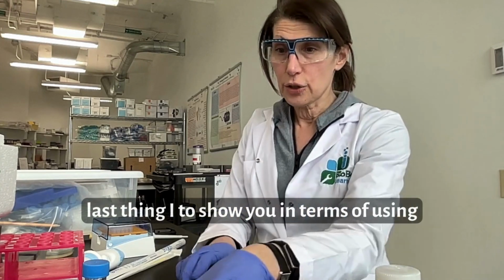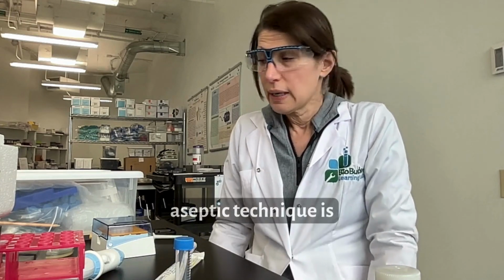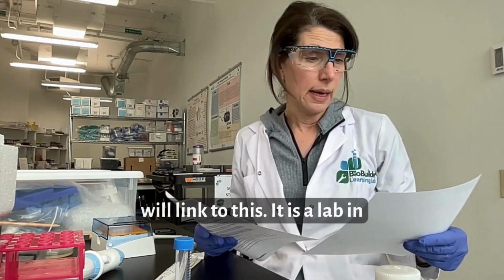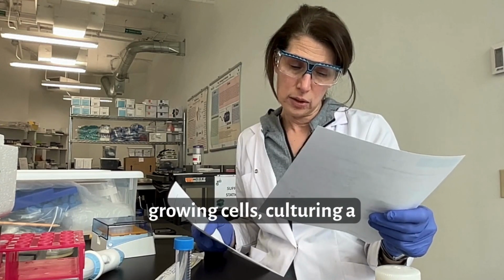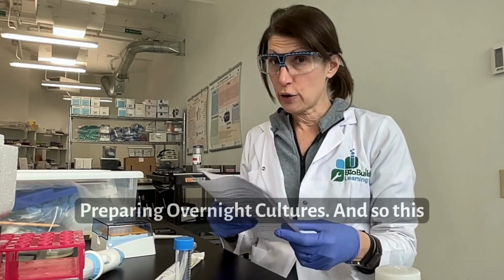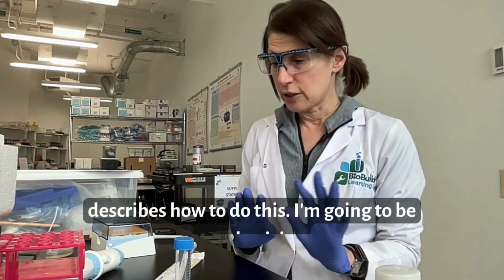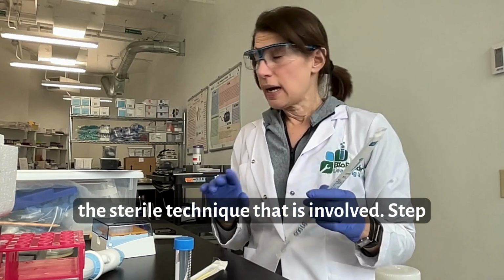The last thing I want to show you in terms of using materials for aseptic technique is part of a lab that we run, and I will link to this. It is a lab in growing cells, culturing a colony from BioTechBuilder lab skills. It's called preparing overnight cultures. And so this protocol explicitly describes how to do this. I'm going to be emphasizing the sterile technique that is involved.